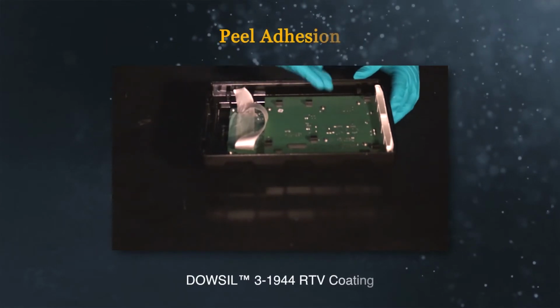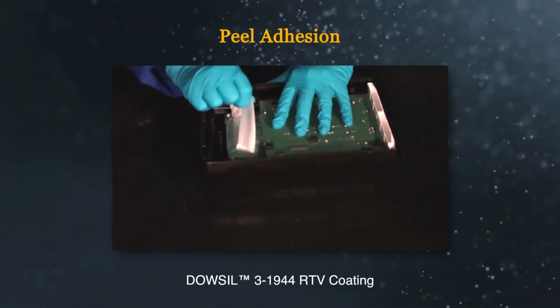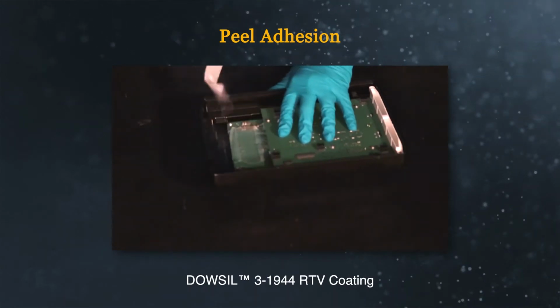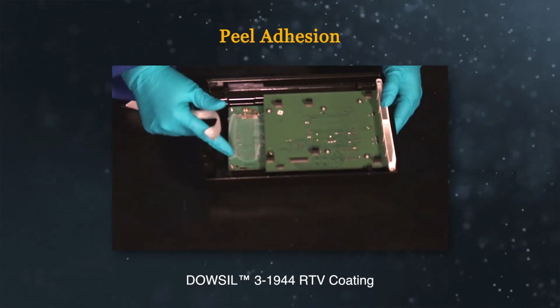Peel adhesion can be run directly on devices and parts. It is much less sensitive to bond line thickness or flatness and can even be run directly over circuit boards to test adhesion of gels and encapsulants.